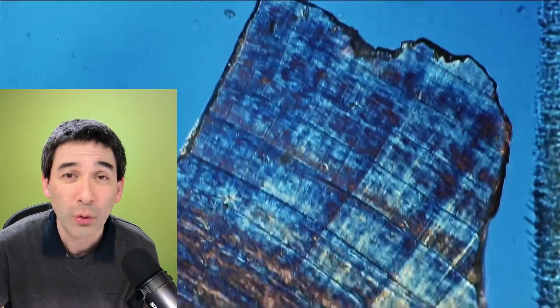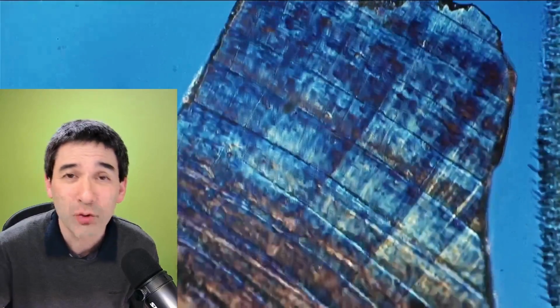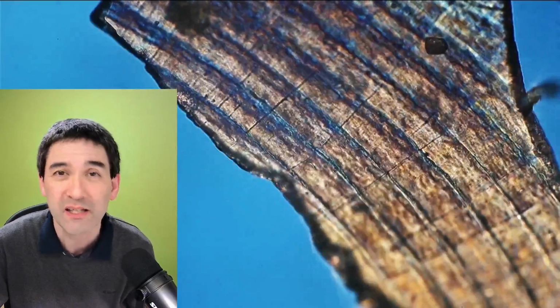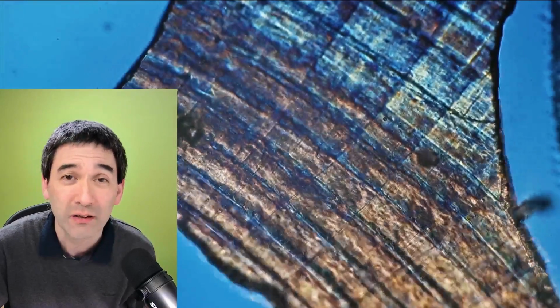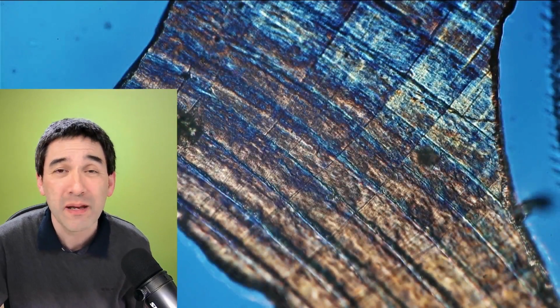So this now is a so-called dry mount. There is still no liquid in there yet, so this fragment is simply sandwiched between the microscope slide and the cover glass, surrounded by air. If I now add a liquid to it, the liquid will easily spread by capillary action beneath the cover glass and the microscope slide. Okay, and this is basically what I've done.